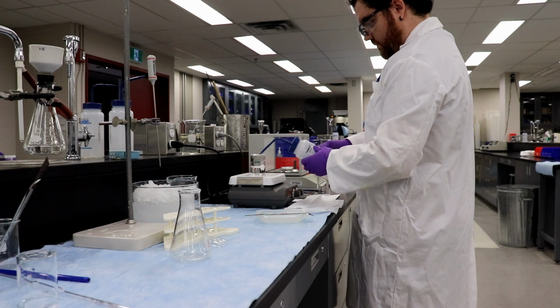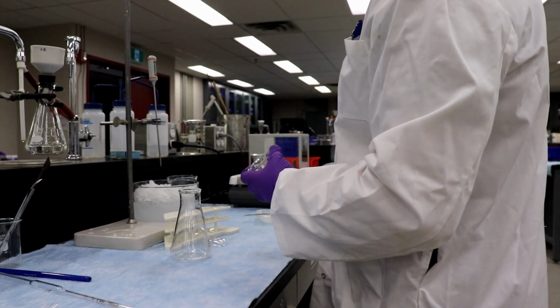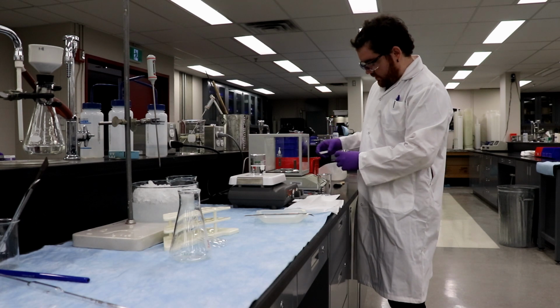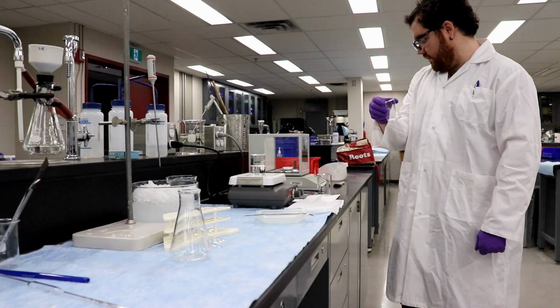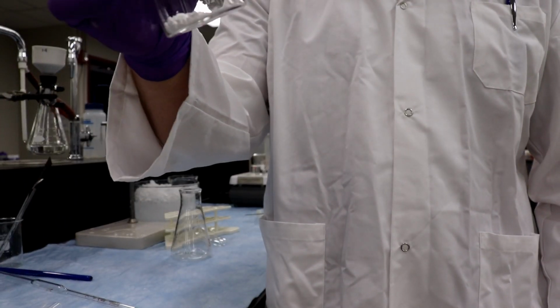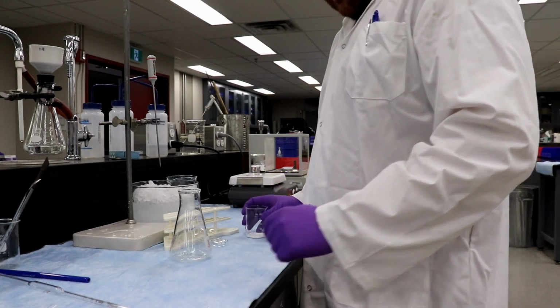Okay, so just to confirm, 1.0054 grams. Correct. Okay, I'm going to put this in there. Is it still powdery? What's the texture like? It's grainy, and it looks like it all transferred. We have 0 left on the balance, so our remaining on the boat is 0, and it's pebbly, like little grains of rock or sand. If I crush this up with a mortar and pestle, it'll be really fine and powdery. It looks pretty good. So it all transferred.